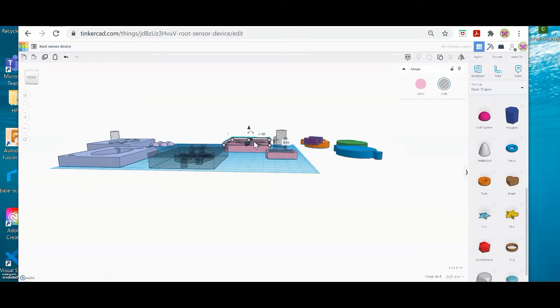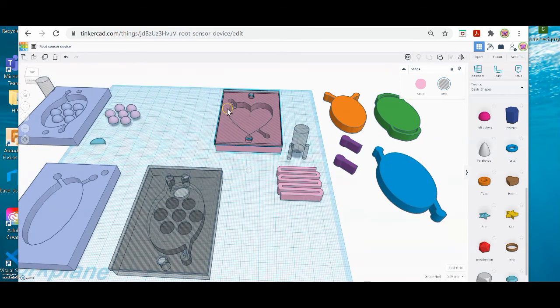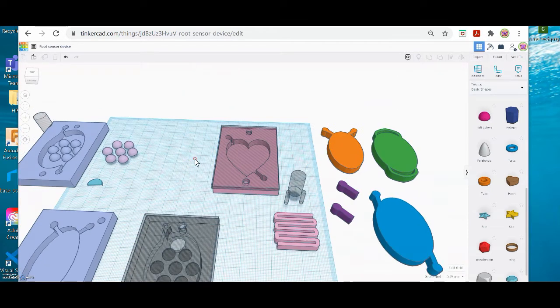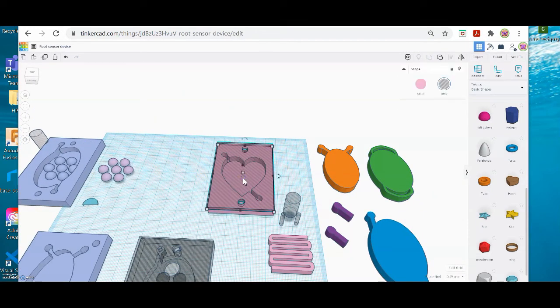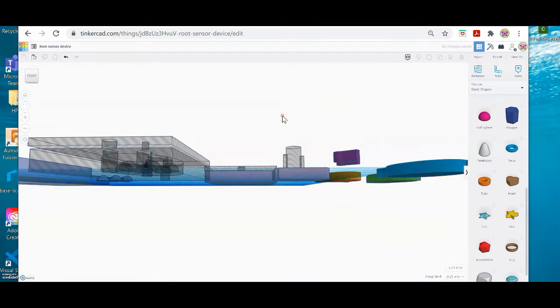You can zoom in using the rollerball on your mouse, if you have such a rollerball on your mouse. And then I'm going to pan a little bit. And you just want to get the top and the bottom aligned as best as possible.